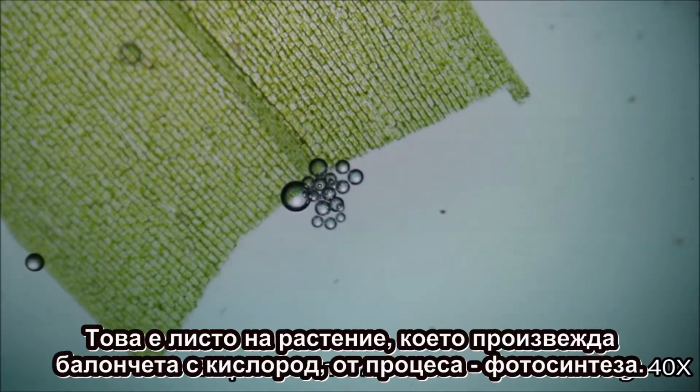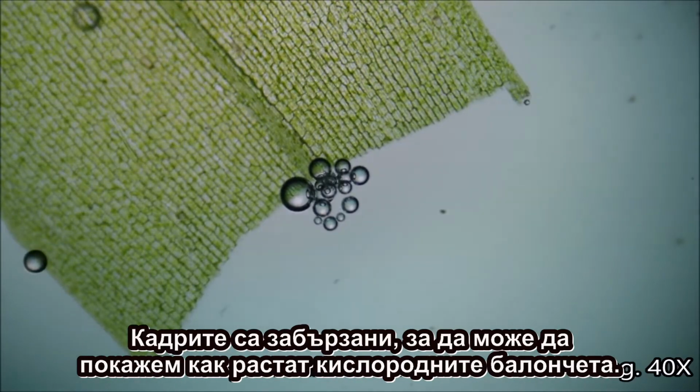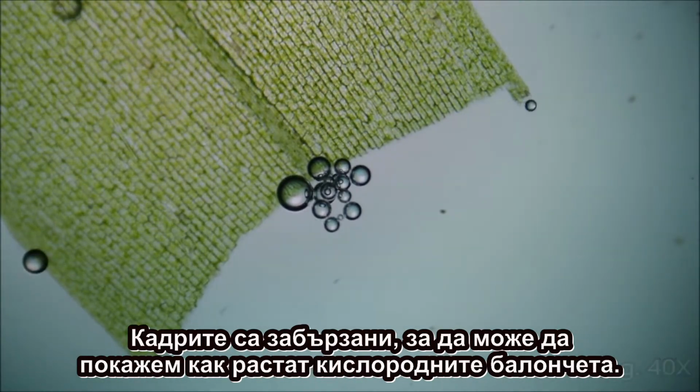This is a plant leaf producing oxygen bubbles by the process of photosynthesis. This footage is sped up in order to show oxygen bubbles growing.